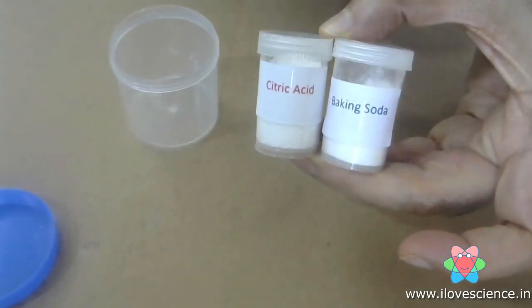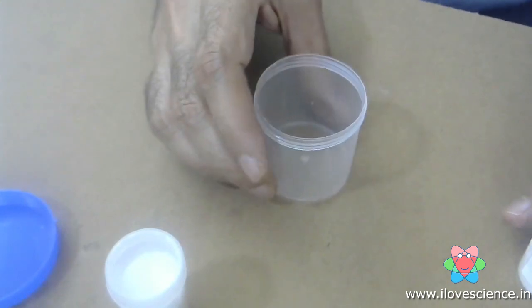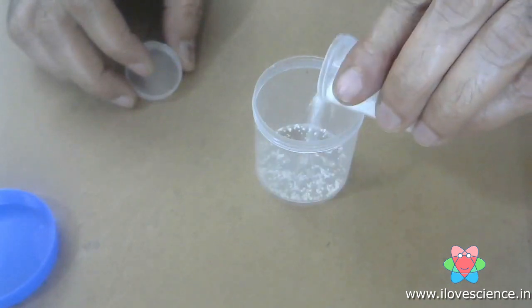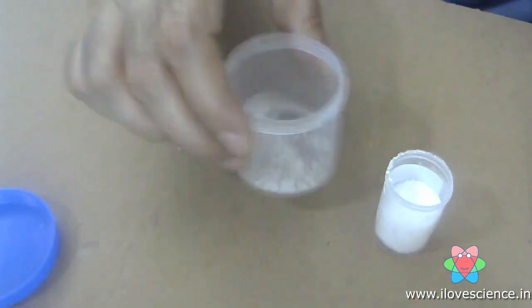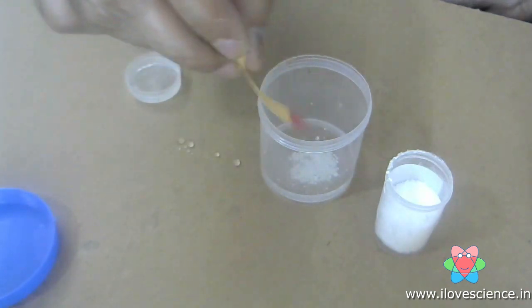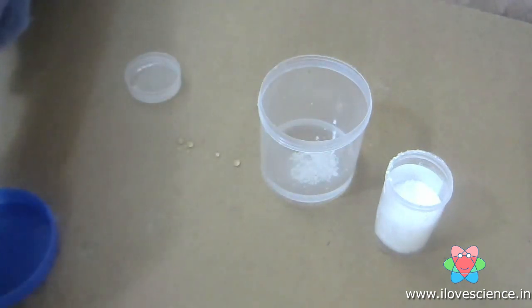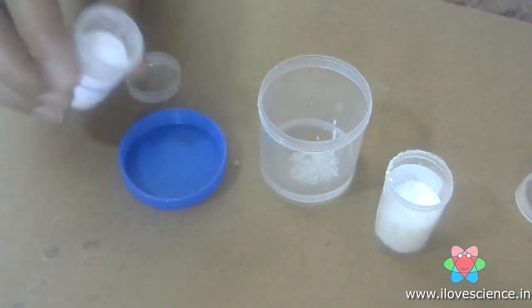So for this experiment, we have citric acid and baking soda. And then we will do the experiment in a little container here. Okay. So I will put the citric acid first in the container and add some water. Now if we test this solution on pH paper, you will see that it will turn the pH paper red, which means it's an acid. So let me dip it in the citric acid solution, and you can see the paper turned red, which means it's an acid, right?